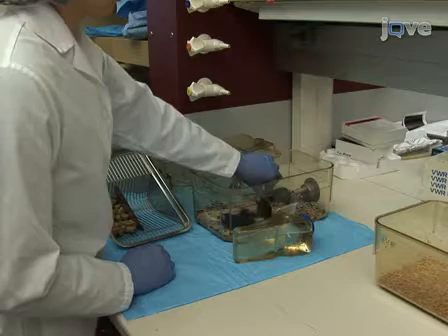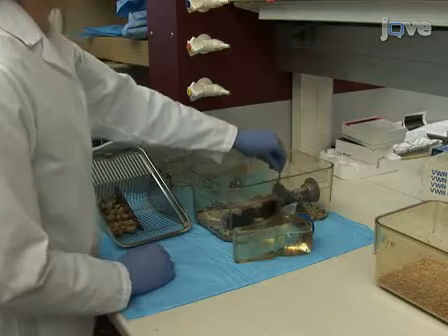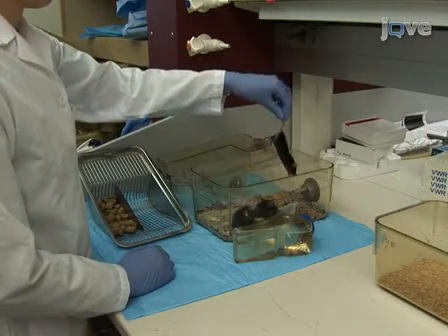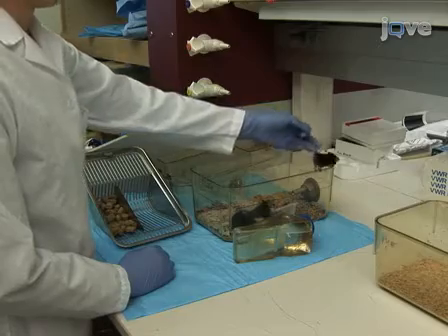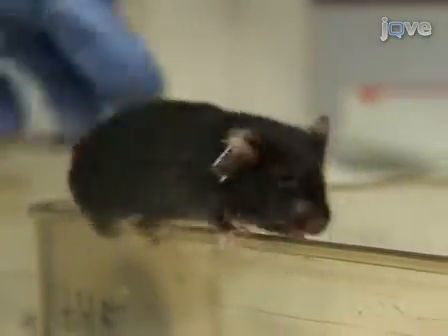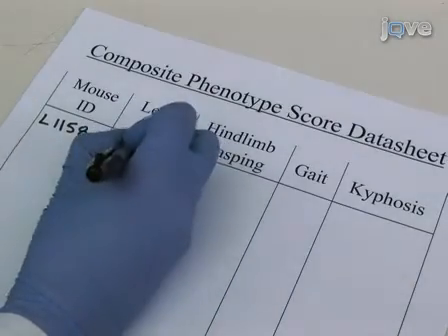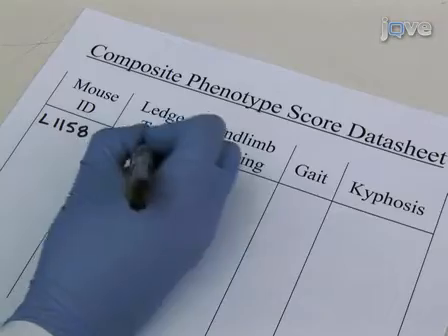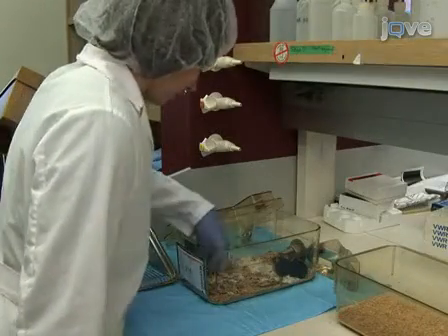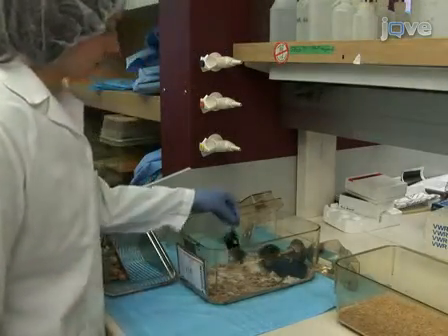Begin by lifting the mouse from the cage and placing it on the cage's ledge. Observe the mouse as it walks along the cage ledge and lowers itself into its cage. A wild-type mouse will walk along the ledge without losing its balance, and will lower itself back into the cage gracefully using its paws. This behavior is assigned a score of 0.